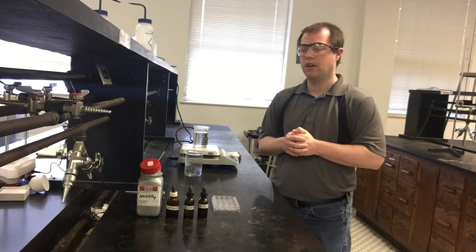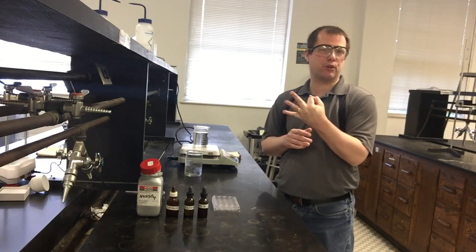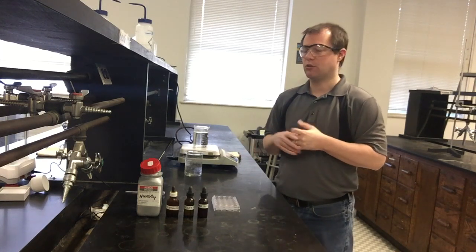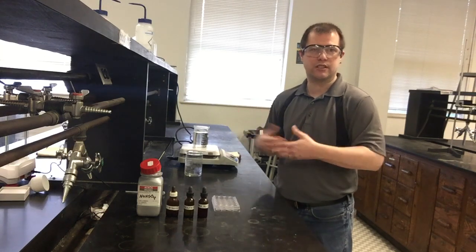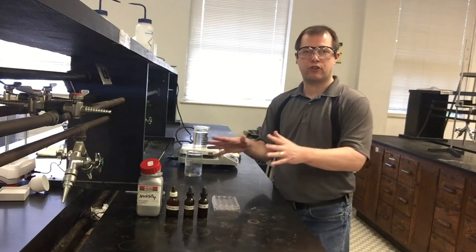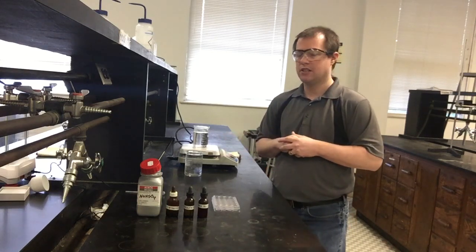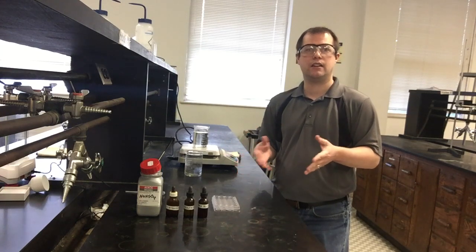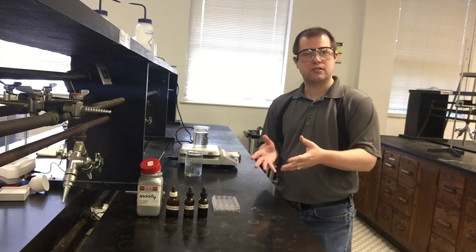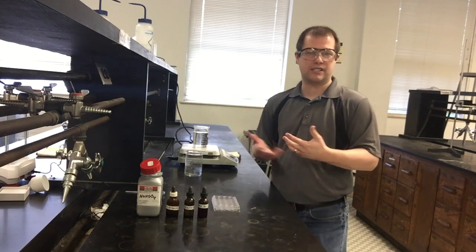We have three main parts of the experiment, three real reactions that we're going to take a look at. So we'll break things down into each of the three reactions individually. But first some general things as far as setup, and then I'm going to change some camera angles so you guys can see colors more clearly, because that's really going to be the focus of everything today: looking at color changes as we make different adjustments to our equilibrium mixtures, and that we can use that then to get information about our reactions and what's happening.